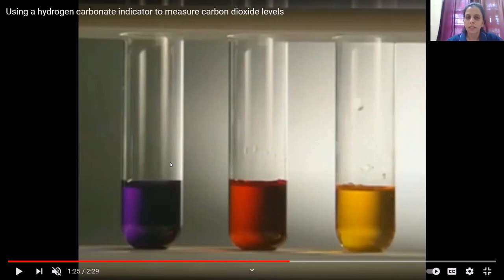Now what happened is, in test tube A the color is purple because in test tube A a fresh leaf was placed. So this leaf, when it is placed in front of bright light, obviously will perform photosynthesis. In the process of photosynthesis, the entire amount of carbon dioxide gas which was present in the air trapped in this test tube was consumed by the leaf.